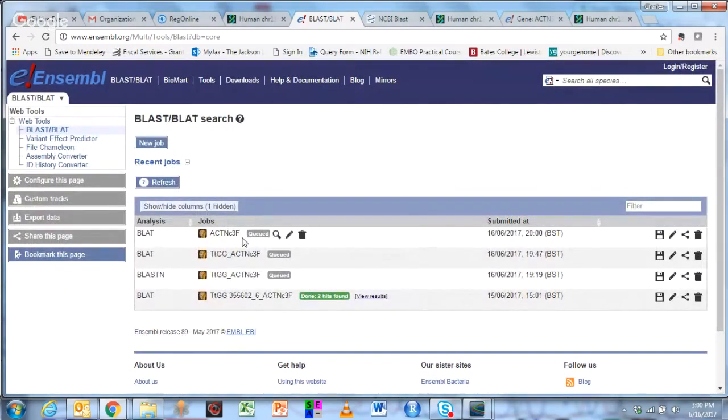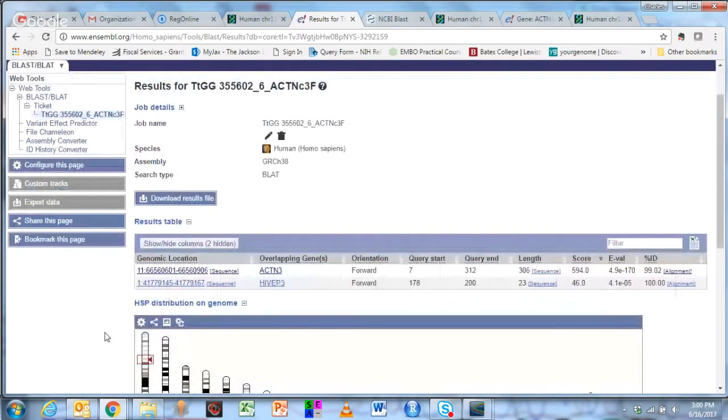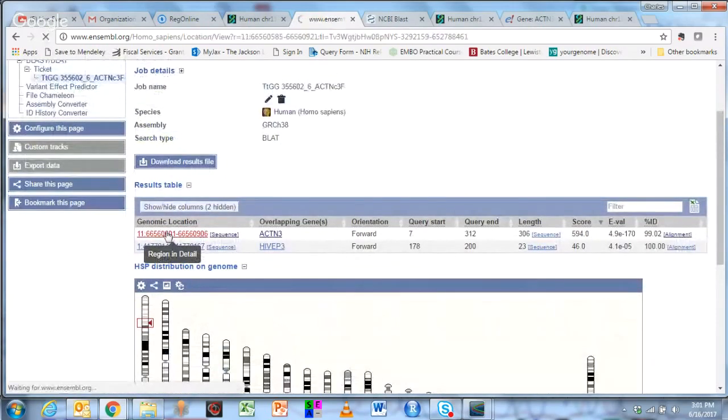I've obviously done this a few times, so I'm trying to get this recording to work right, but let's look at the results here. This usually only takes 30 seconds to update. And you can see here, this is giving you the context in this first screen. The best hit is on chromosome 11 again. Gene is actinin 3, 306 base pairs aligned. Now 23 base pairs aligned on chromosome 1, but that is probably in the intronic sequence. So the native sequence is here on 11. Look at the genomic region here.